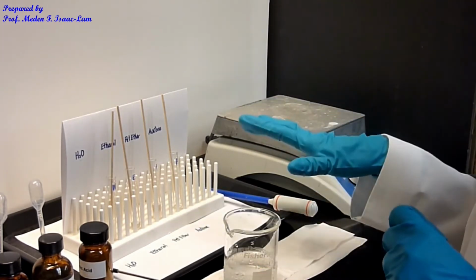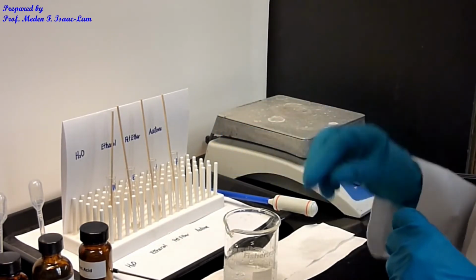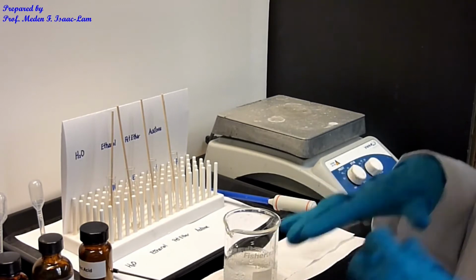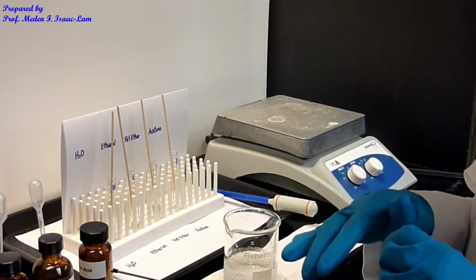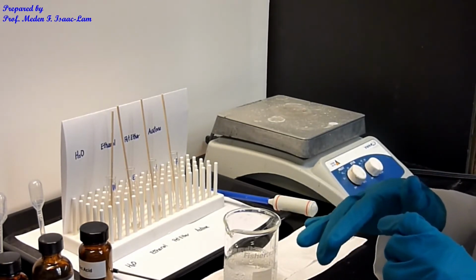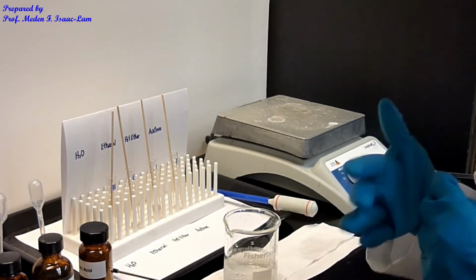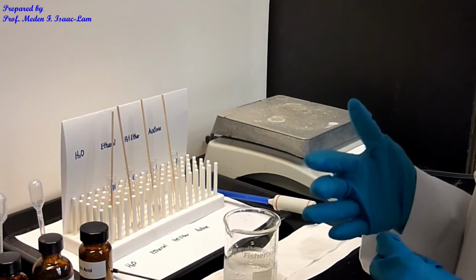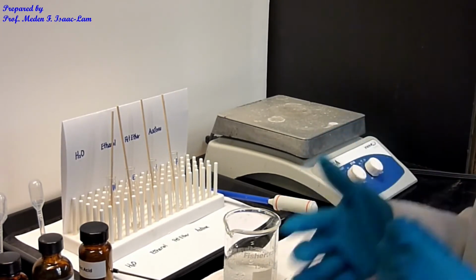From this one, we decide which solvent we're going to use. So write down in your conclusion the reason why you will pick that solvent. It's possible that for this part there's more than one answer, not just one solvent that you can use. There's going to be more than one answer for the right solvent to crystallize impure benzoic acid.